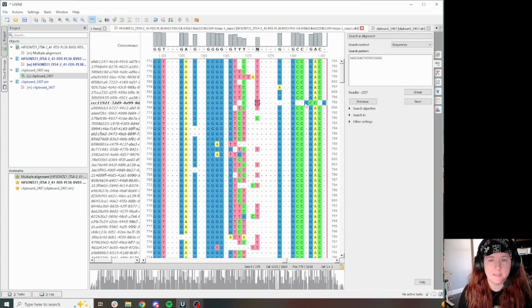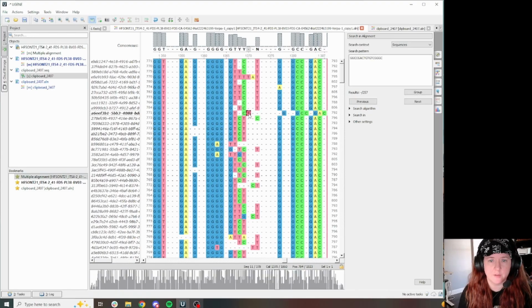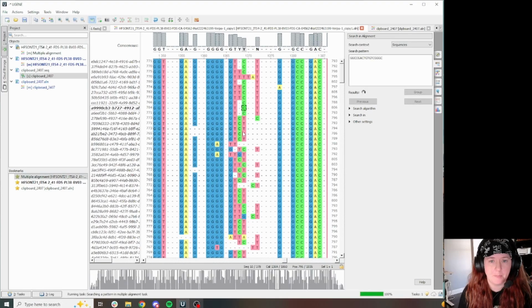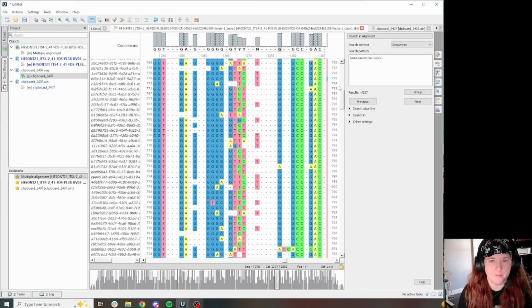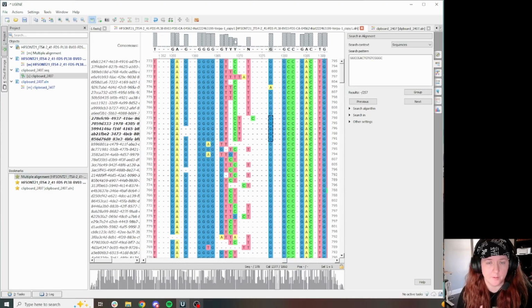And Nanopore can sometimes struggle with reading repeating nucleotides like this. And while it is hard to say for sure exactly what is going on here, I'm suspicious of this. And as I go through and do this, it does align fairly nicely, right? And I can go all the way down here and do that if necessary, but honestly, I don't think it's necessary for this example because of a few other things I want to show you.